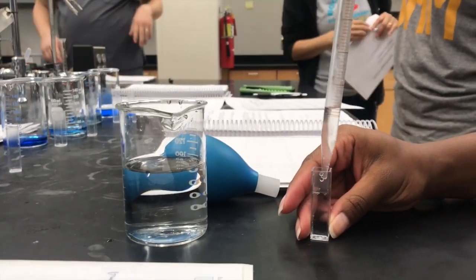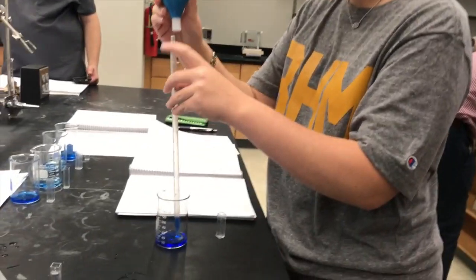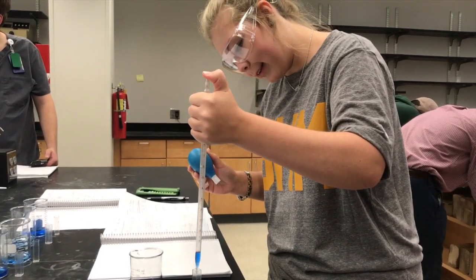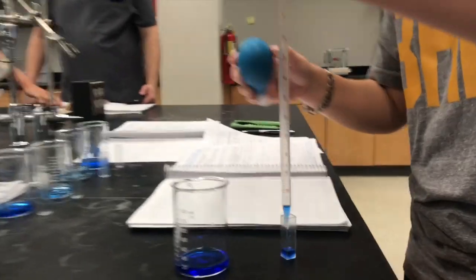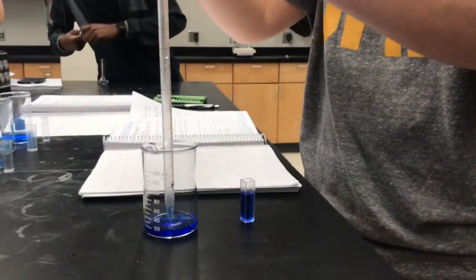spectrophotometer. The first cuvette you must prepare is a cuvette full of water. This is your blank to put into the spectrophotometer. Use pipetting techniques to put the dilutions into the cuvettes. Notice how she continues to fill the cuvette until the meniscus of the solution is at the faint line at the top of the cuvette.